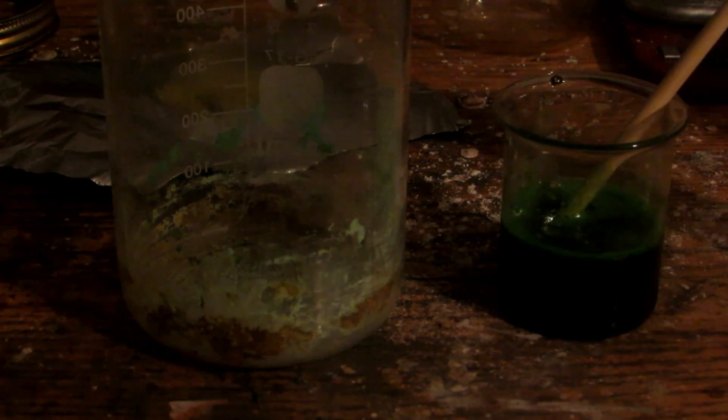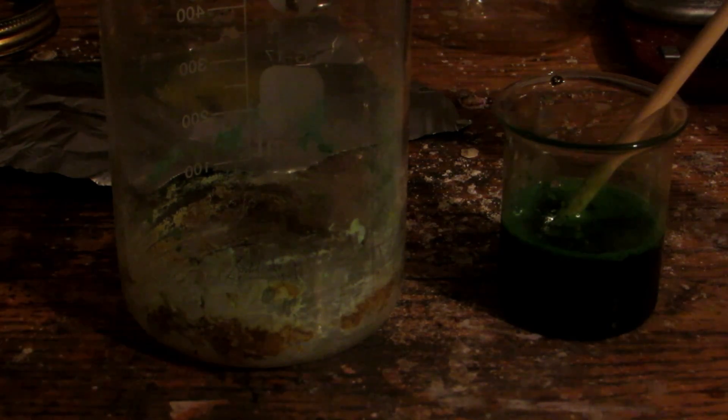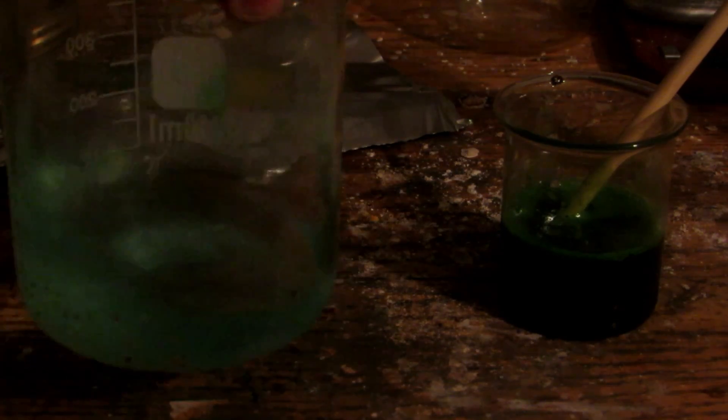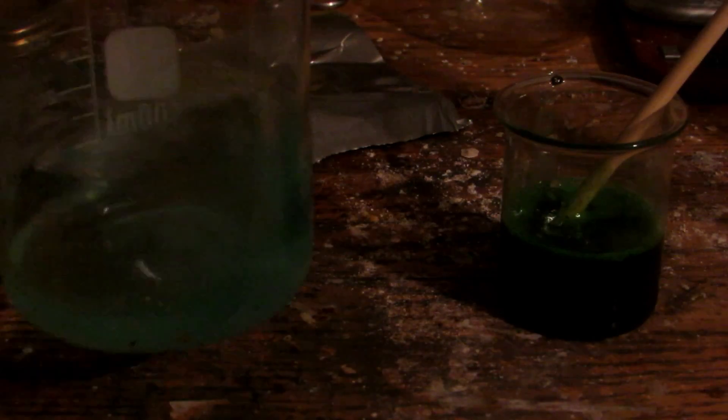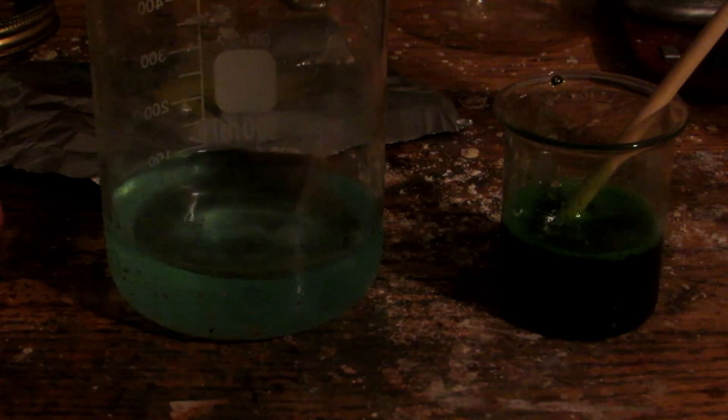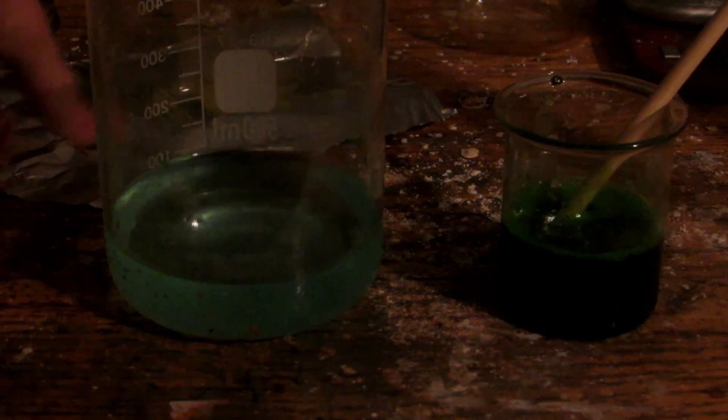Before using it for the chemical garden, I'd like to do just a bit of chemistry with copper chloride, which is rather interesting. You can see it's brown from what I didn't scrape off, but if we add a bunch of water it forms a nice blue aqueous solution — you can see that's nice and blue. Dilute solutions are blue, more concentrated solutions are very green, and this one appears almost black because it's really really concentrated. Even weak solutions of copper chloride form beautiful blue colors.